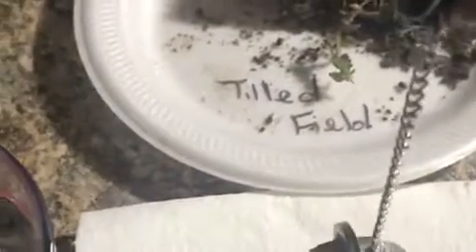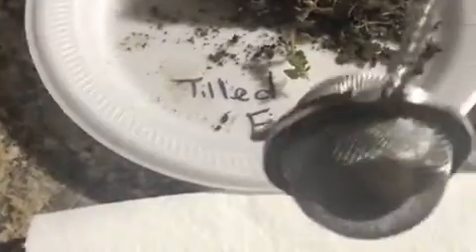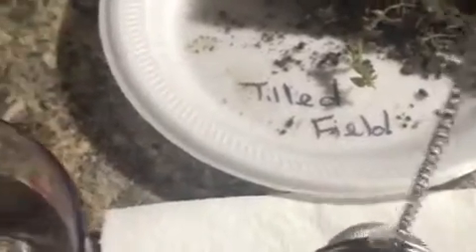Once I'm done, I'll take the remaining pieces of the soil sample and dump them here onto our paper towel to observe the structure and how it held up. Once I do that, I'll let the residue of what I was dumping settle for about 15 minutes. And then I'll pour 50 milliliters into my graduated cylinder and observe as well.